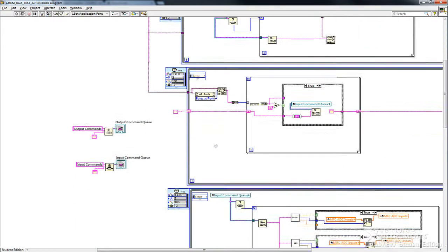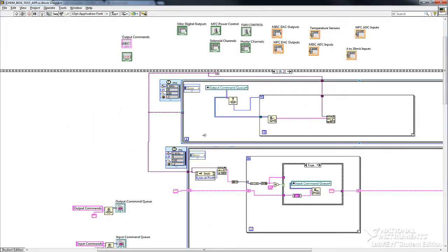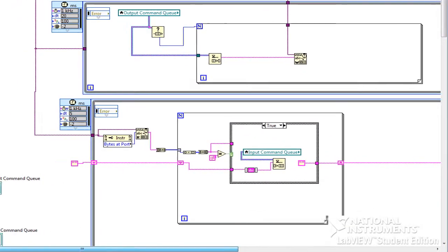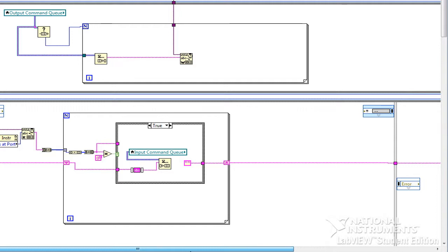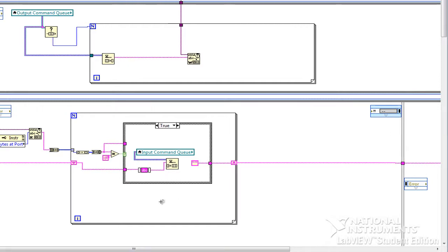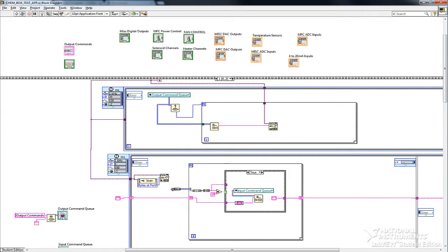Now the next frame in the sequence is a bunch of parallel while loops that do different things. So let me step you through it and it'll make sense. Now for serial port, sometimes in LabVIEW it's tough to write a program that has multiple things going in and out of the serial port. And the best way I've figured out how to do this is with what are called queue objects.